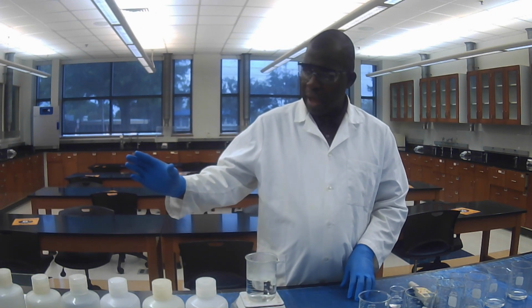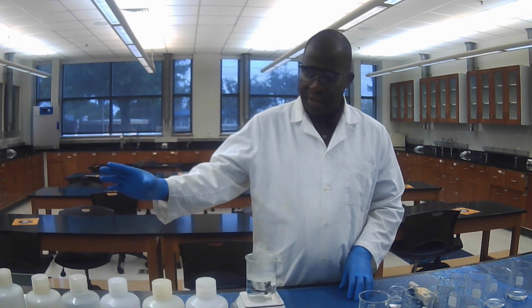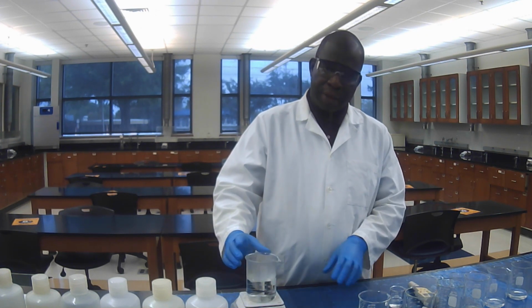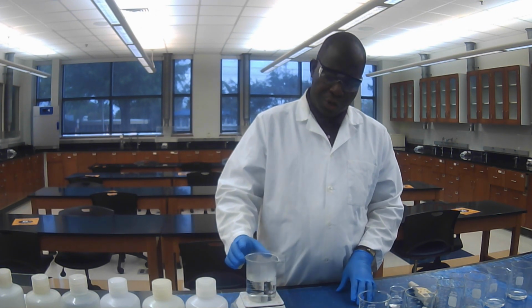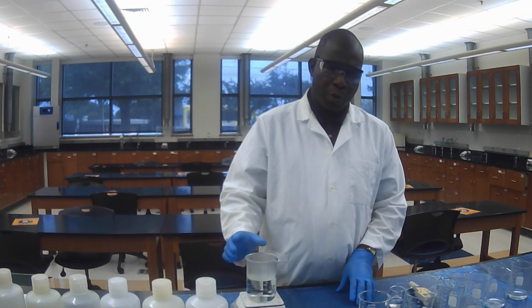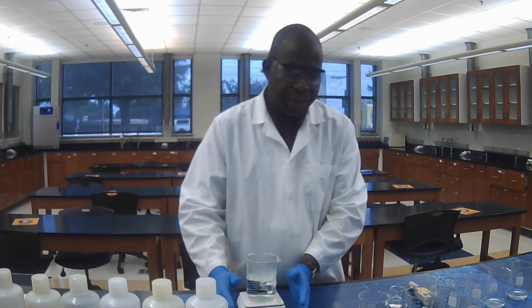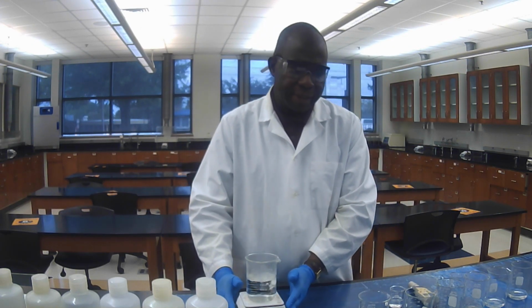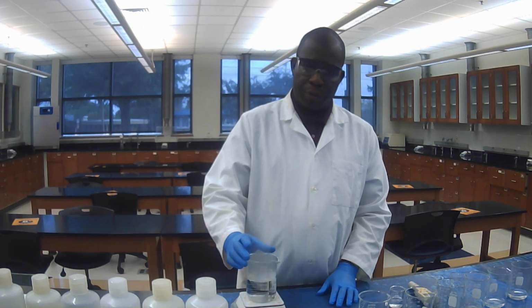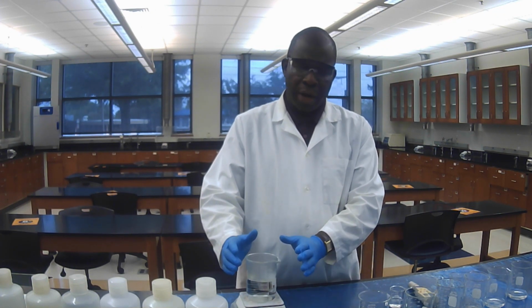I have already done it. Also, you're going to collect the hot plate and set the water on the plate to boil. So we have our water boiling already.